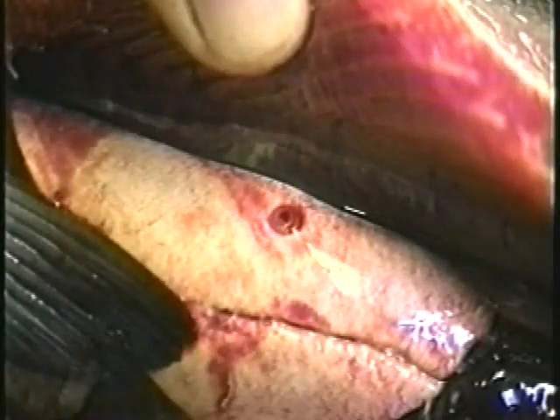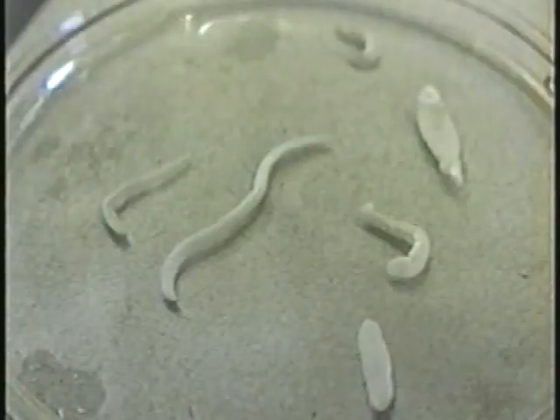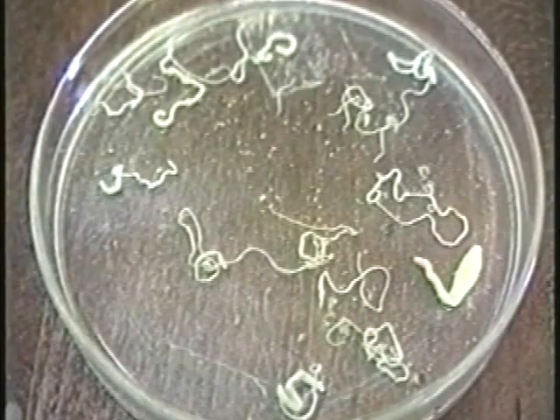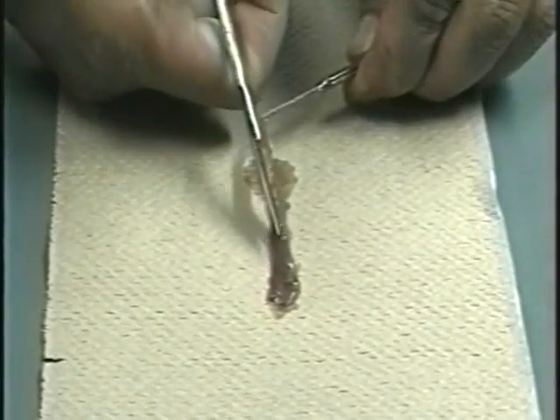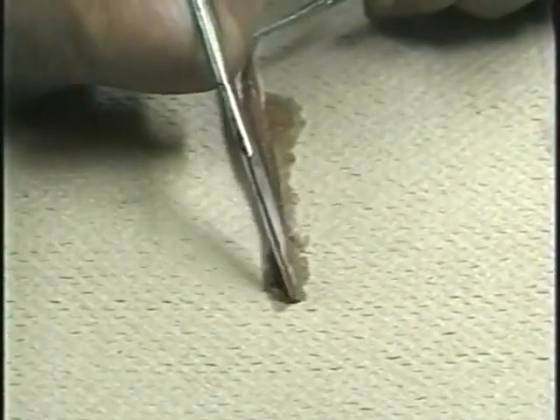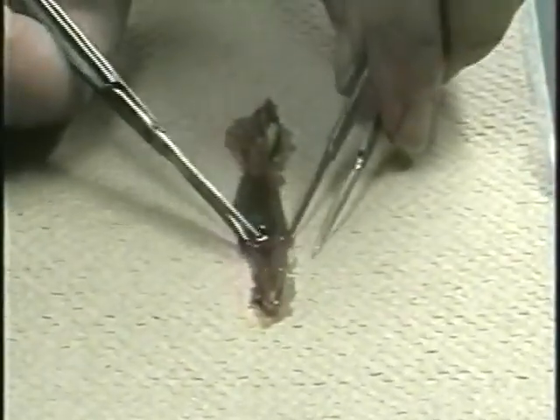It is common, especially in wild fish, to find a variety of parasitic worms. These typically do not cause disease unless infections are heavy. However, they can cause lesions in the fish, destroying muscle quality, and a few can infect humans. After any visible parasites are removed, the intestinal tract should be stretched out and cut open longitudinally. Again, remove any visible parasites.